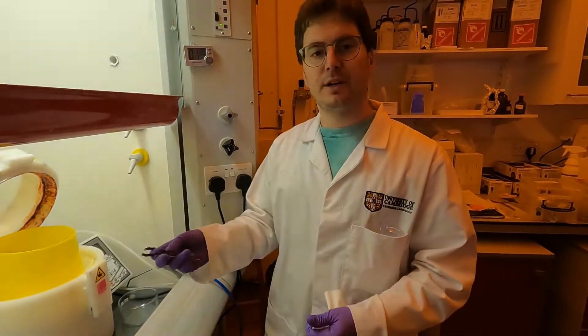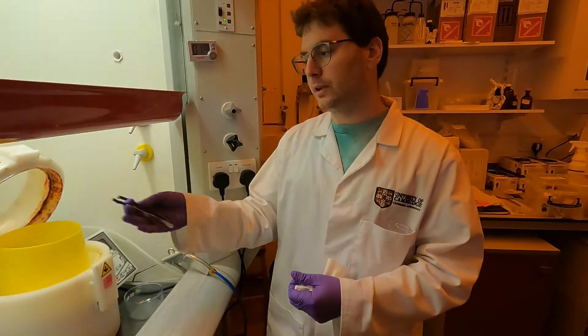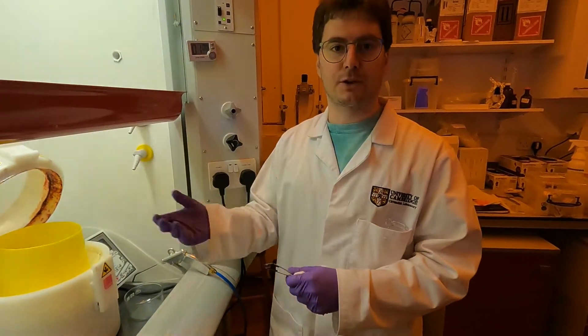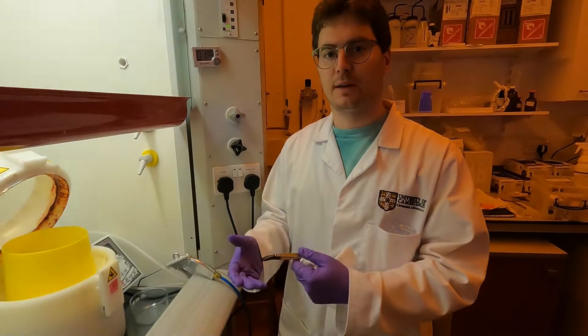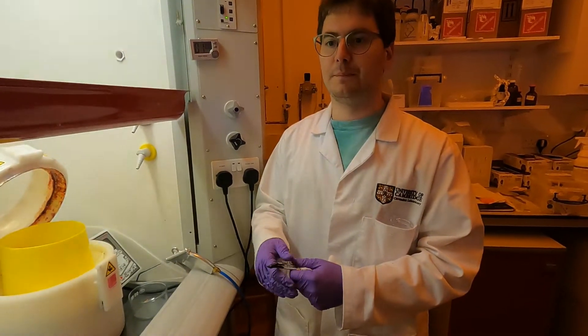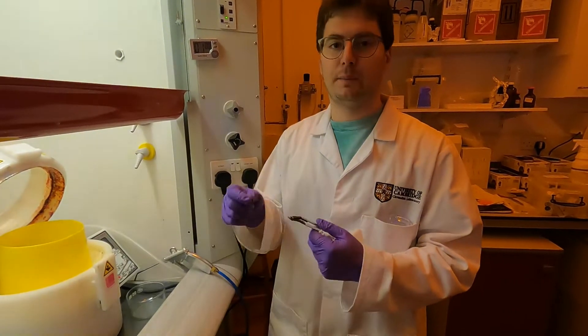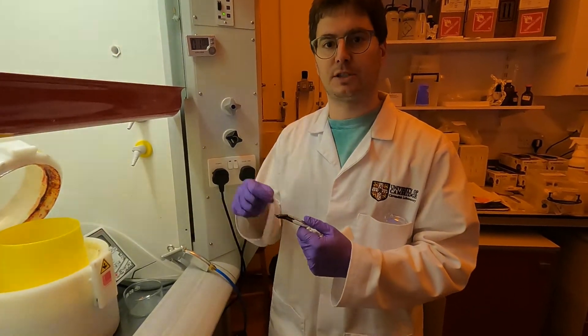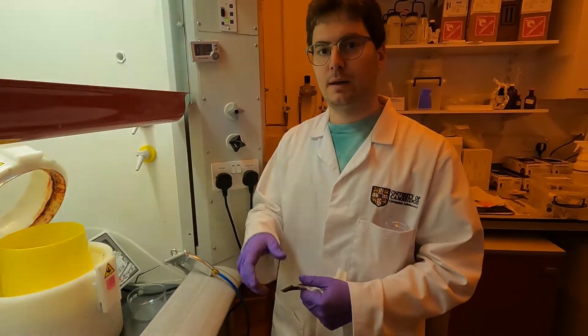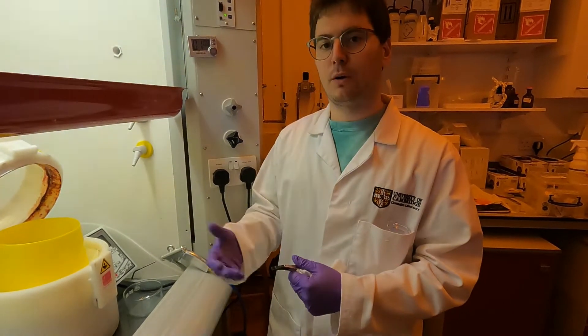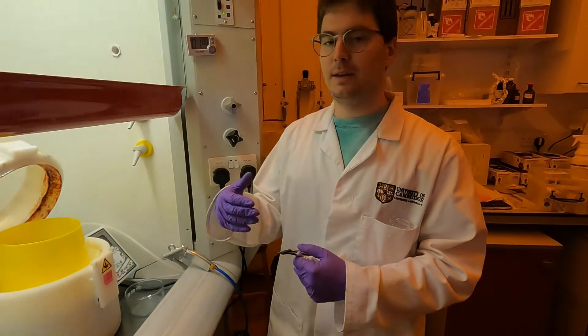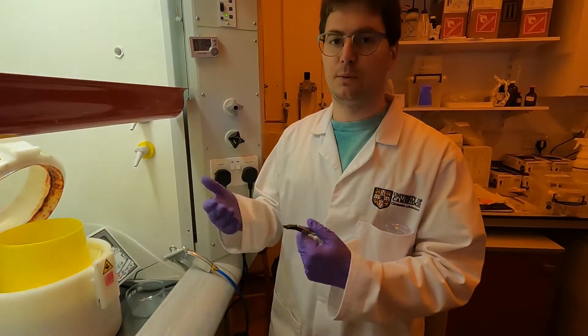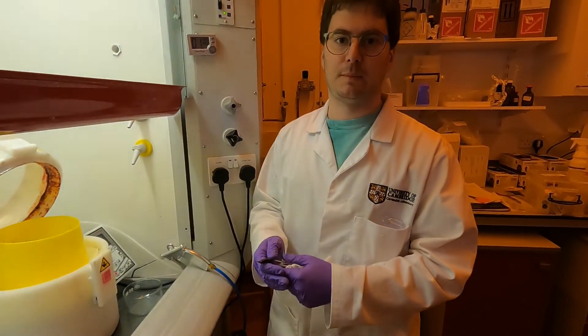We have the pattern on the sample at this point. There's not much you can do if there's something wrong with the sample. You can look at it with a microscope or profilometer, but if there's something wrong at this point, there's not much you can do. A lot of the time there will be small defects, maybe small dust particles around the channels, which may not actually be a problem. But if you see big defects, at this point you will just have to throw away the sample and make a new one.